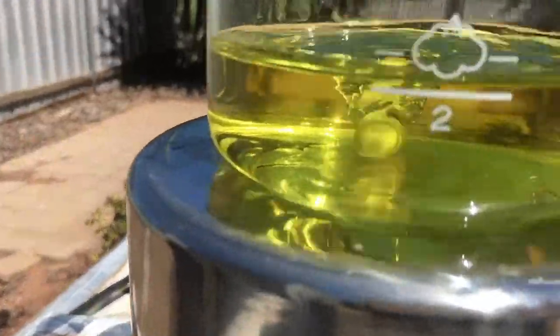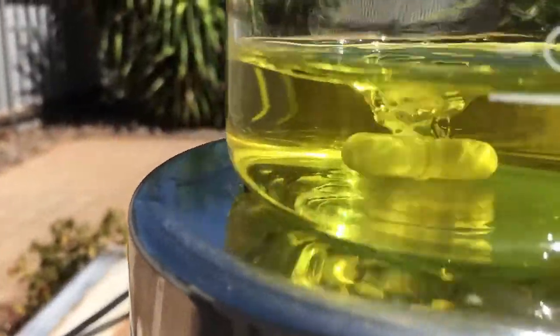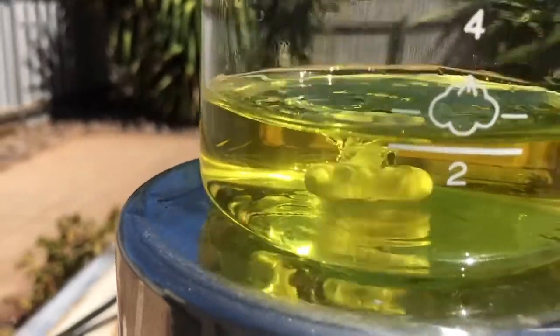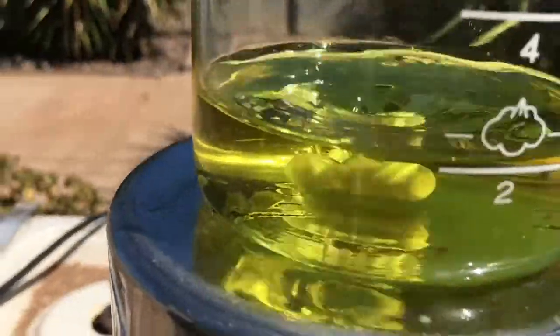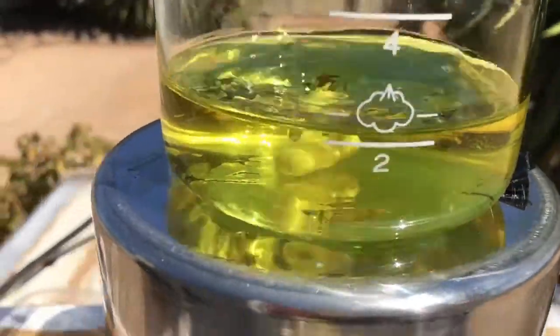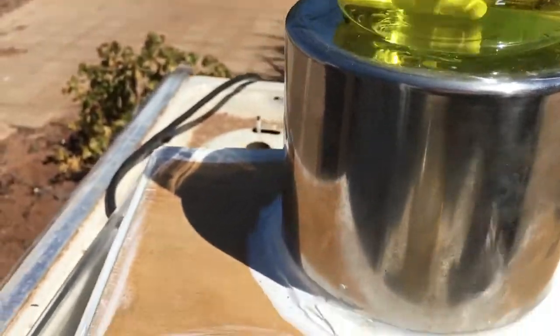As you can see, the stir bar works much better and smoother. I think I might have chose this, it's too small, but it is stirring it up pretty well. I've stuck it down with some sticky tape folded around itself just to stop any vibrations and losing my little jar while I'm not around. So I'm about to add my zinc sulfate.